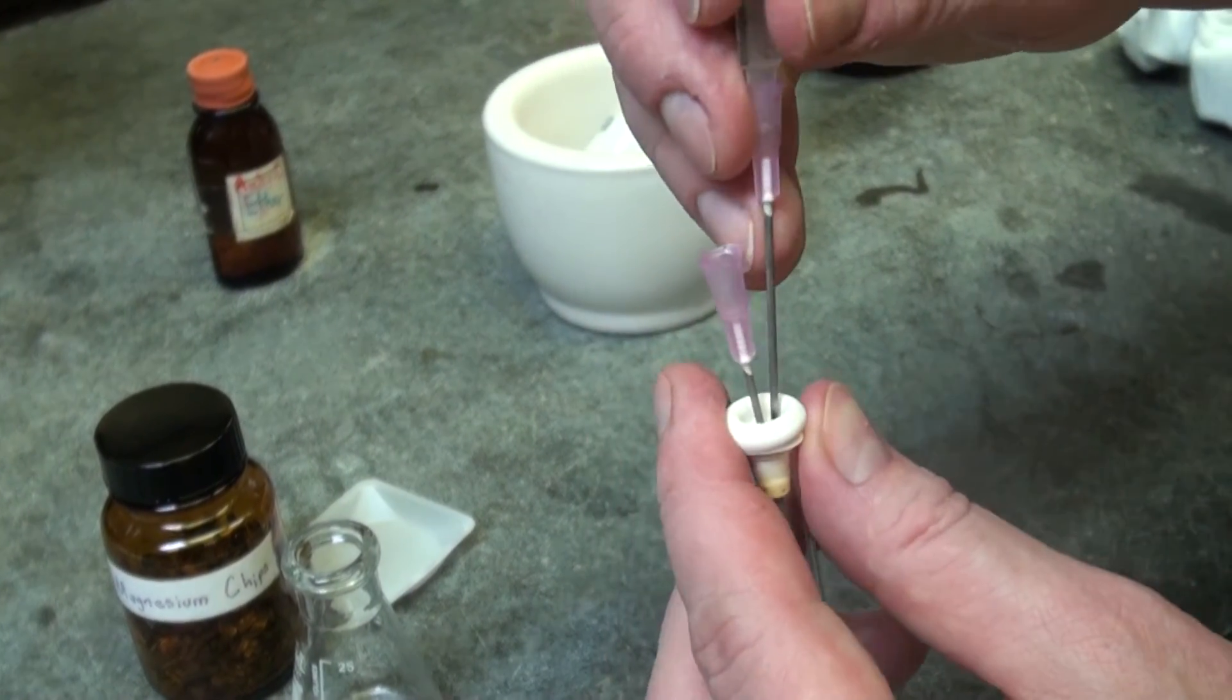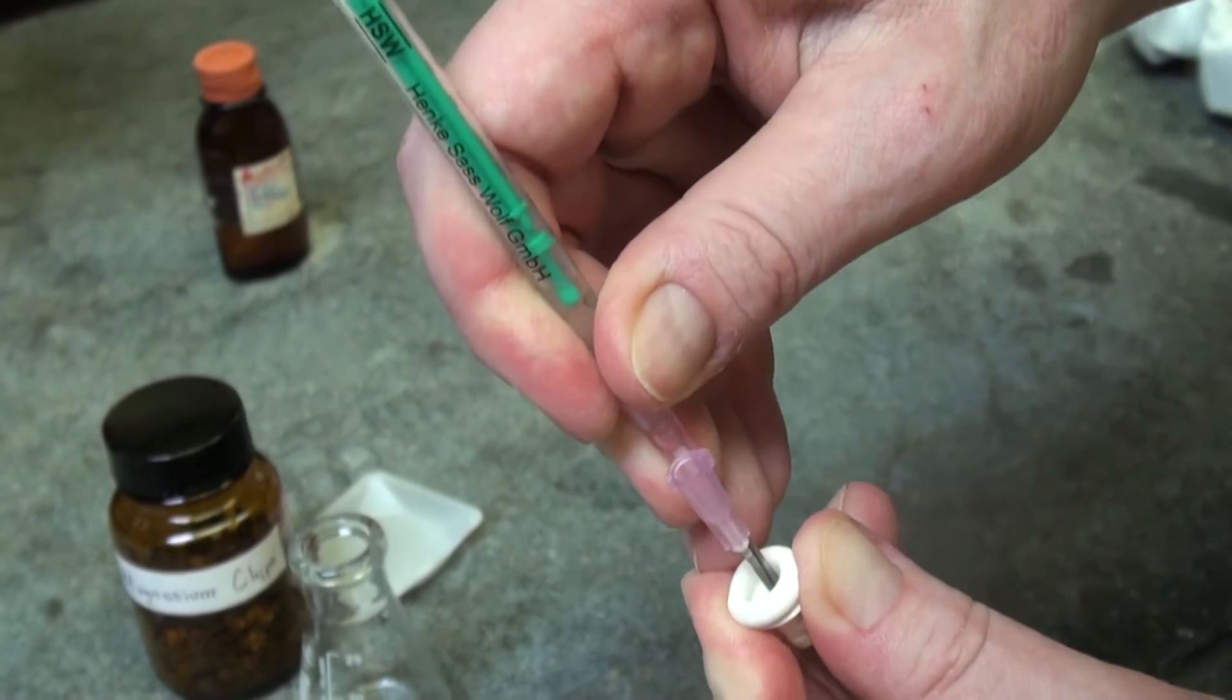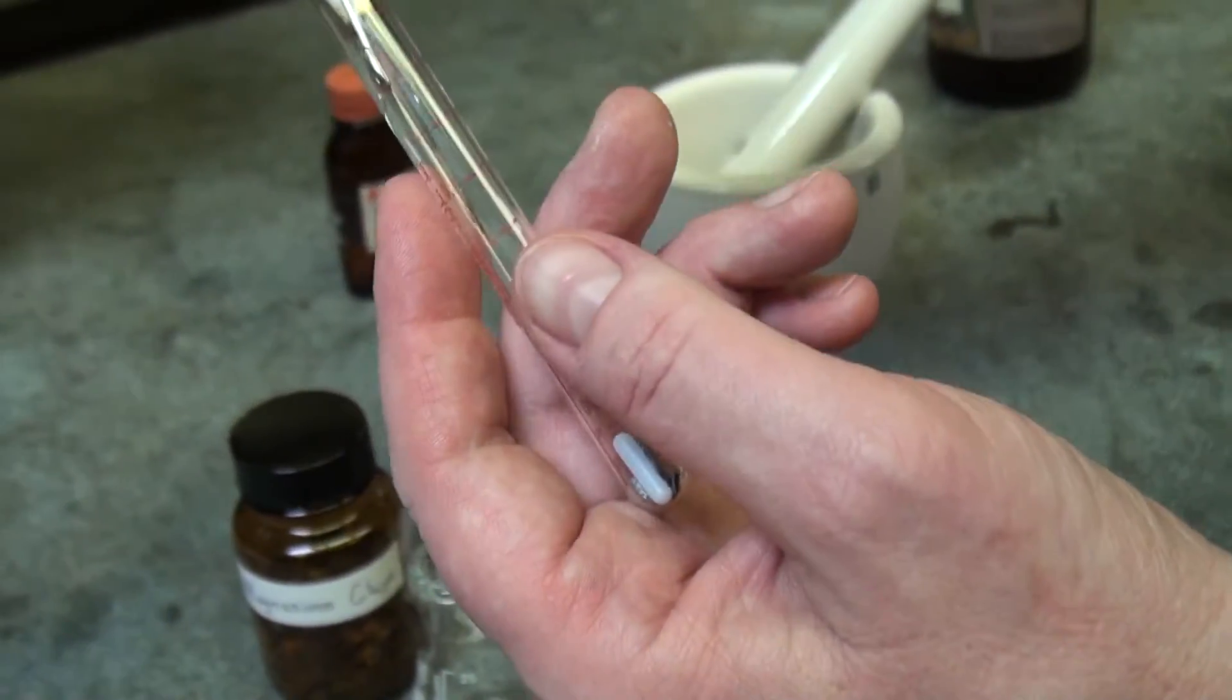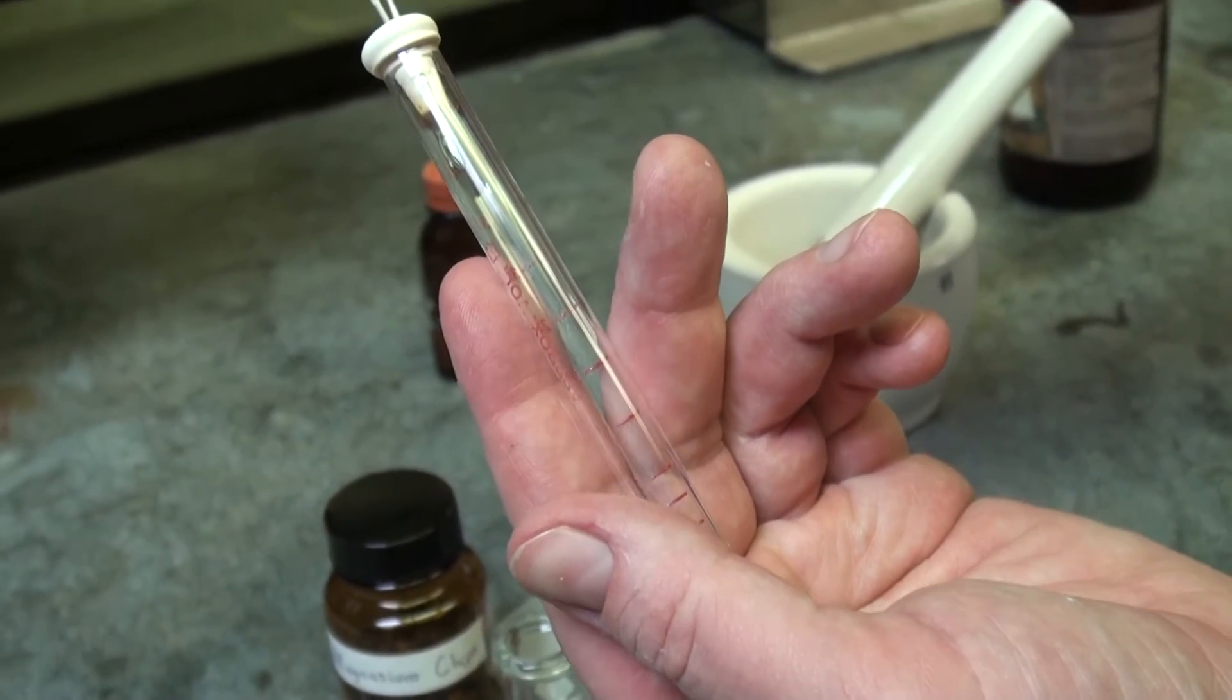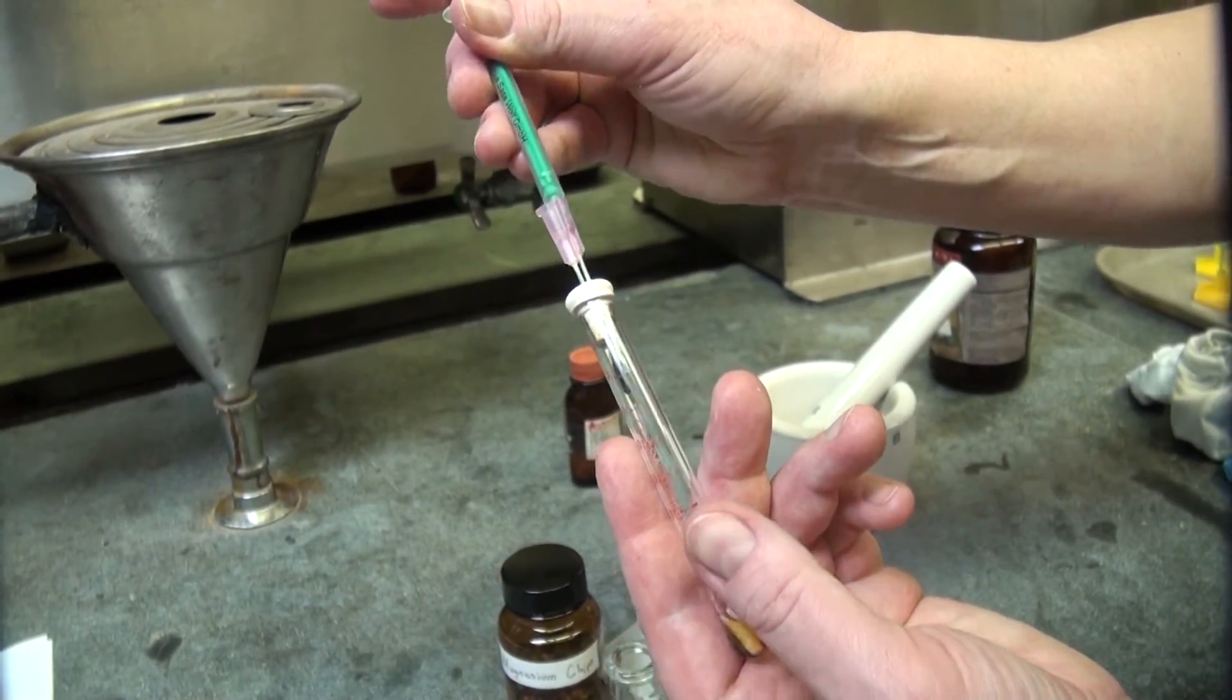And now you have to add the ether into the reaction tube through the septum, also pushing through the septum. So now you see two needles in here and I add the ether and you see the color that's from the iodine.